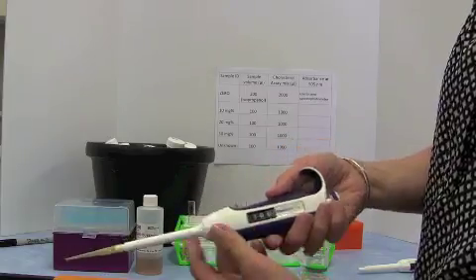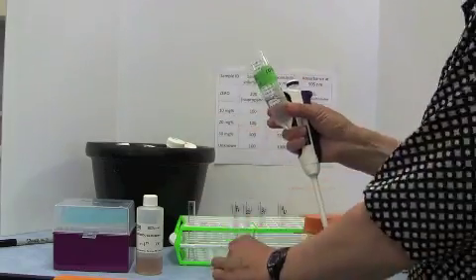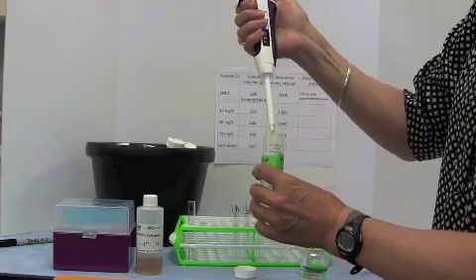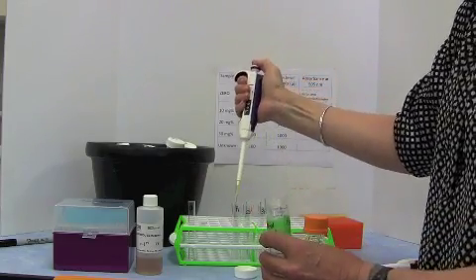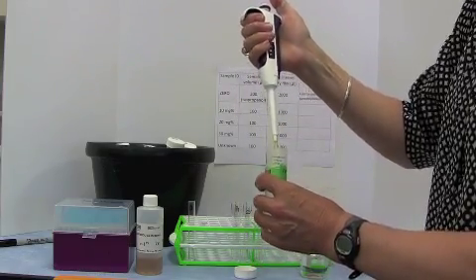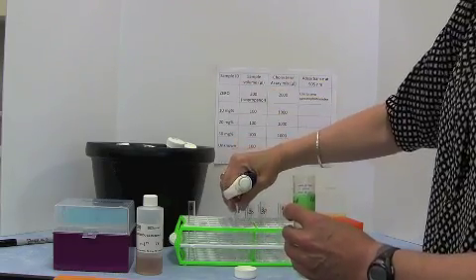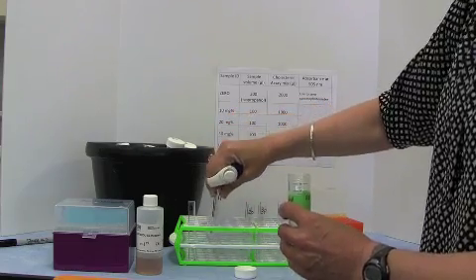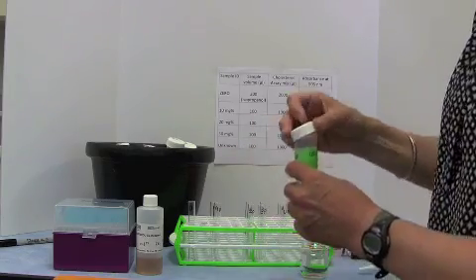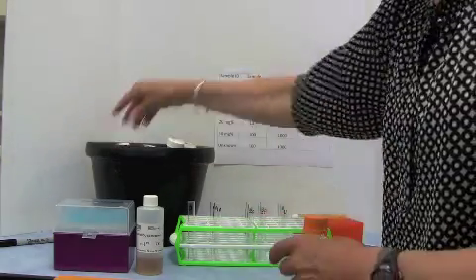There we go, so that's now set to 100. Get our 10 milligram percent sample, and we're going to pipette 100 microliters into each of these two tubes, like that. And once I add, I'm actually going to move the tube so I can see where I am along the row here. I know that I've made an addition to those tubes, so I'm just going to move them down the row.